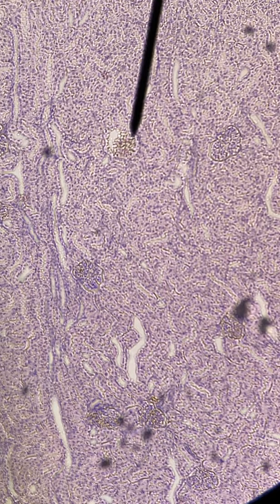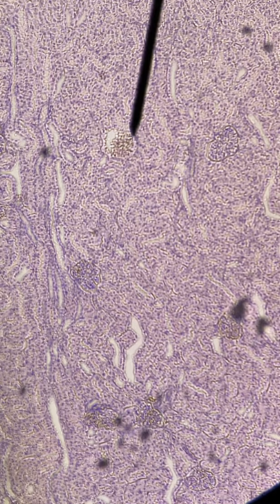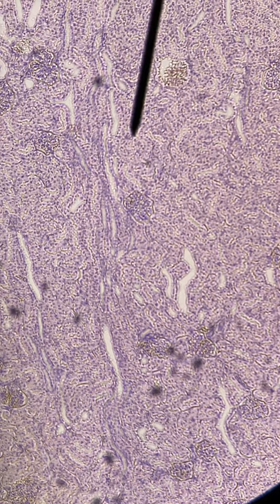There's even a little white line around it. Let me see if I can't find a different one. This one right here might be good. Let me zoom in on it and see what we can get.